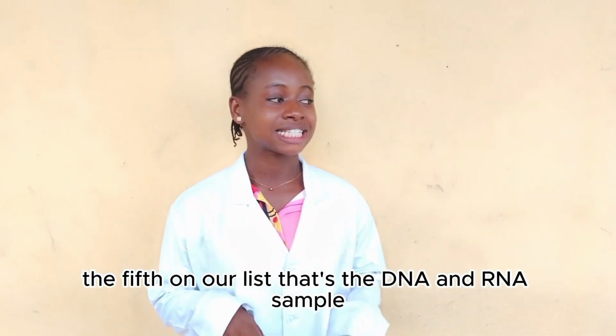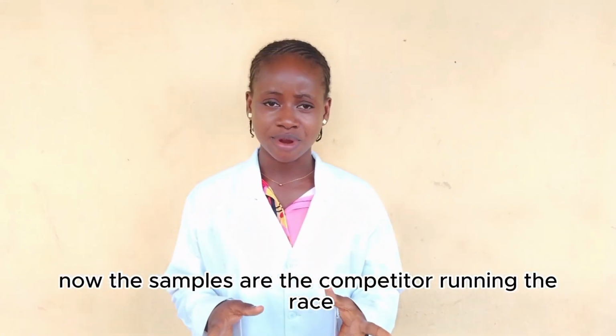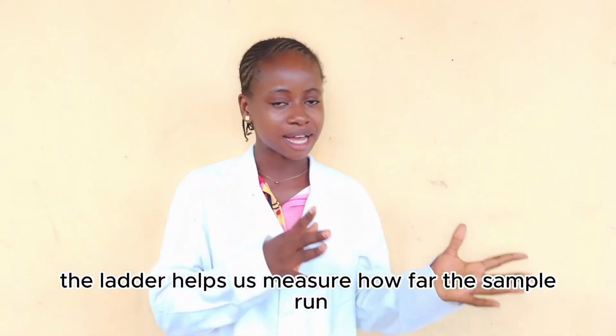The fifth on our list, that's the DNA and RNA sample. Now, the samples are the competitors running the race. Now, we have the ladder. The ladder helps us measure how far the sample ran.